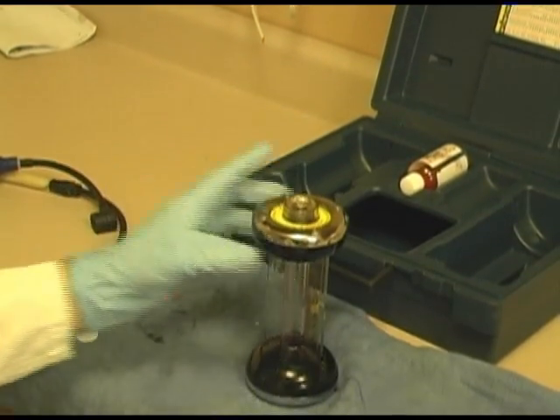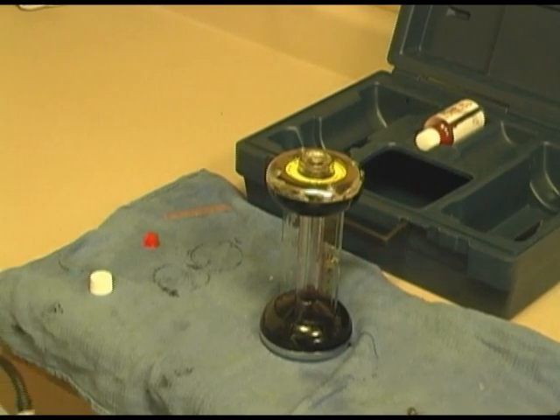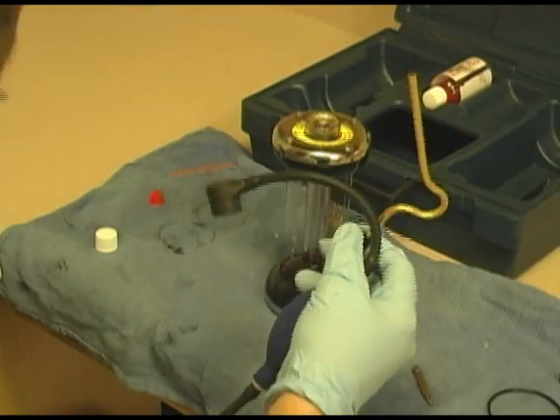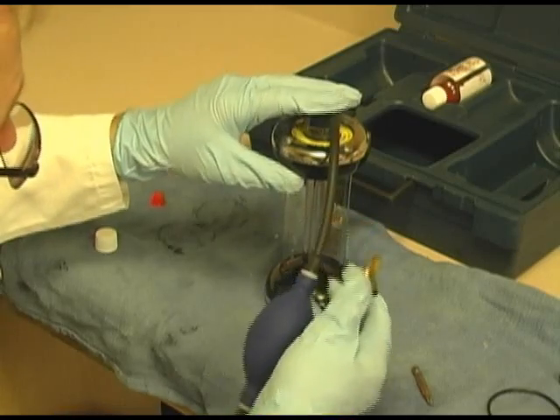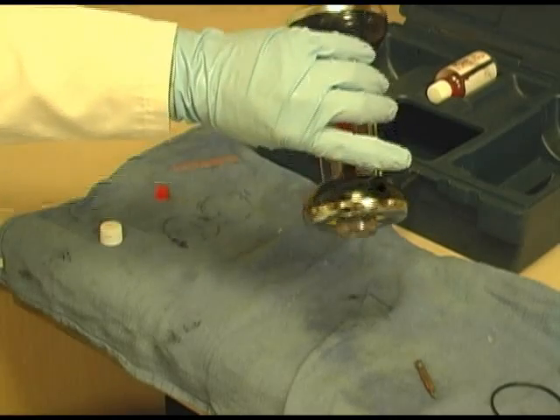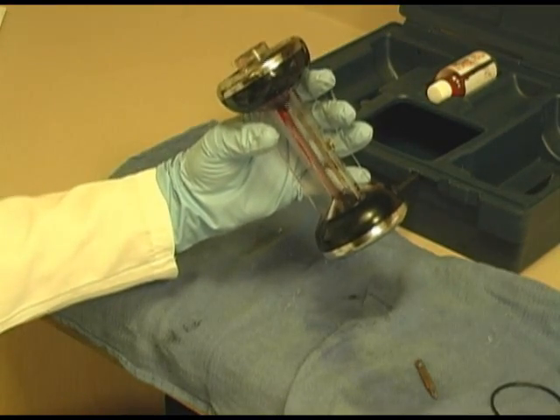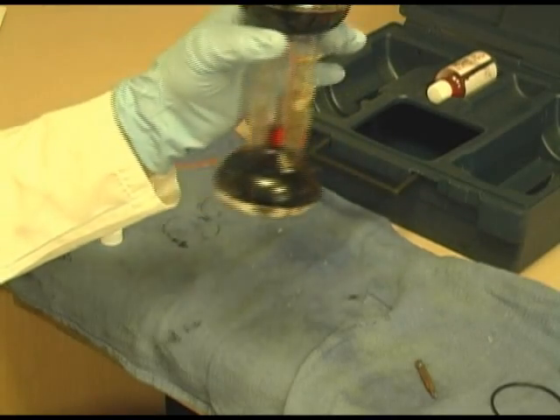Zero. I'm going to get in the picture a little so you can see what I am doing. I'm not saying this is a good technique as far as cleanliness, but hey, we're going to take a measurement. We are at zero. I am going to push this button down, and we're going to take a sample. The sample we're going to take is of our breath. Take a deep breath. There you go. It's not quite 4.5, but you get the idea.